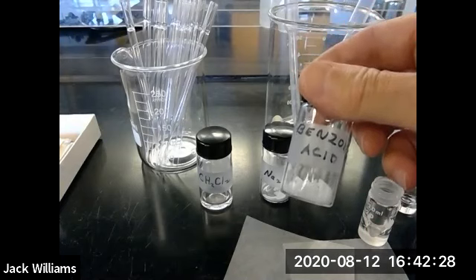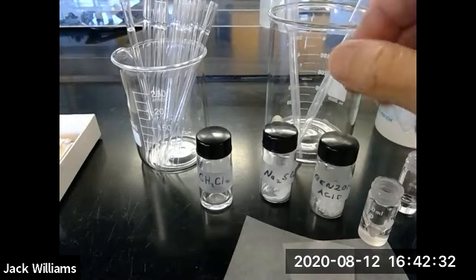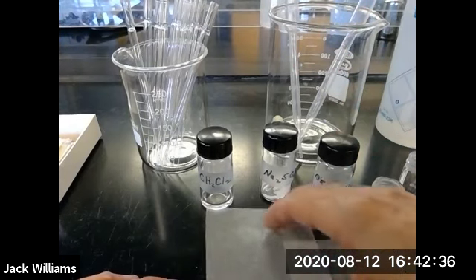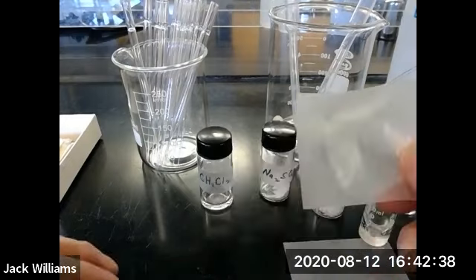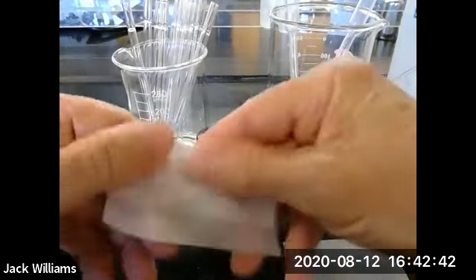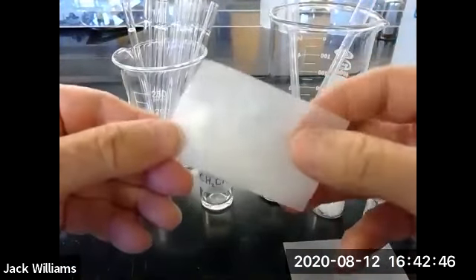All right, so there's your benzoic acid. You're going to weigh up a certain amount of this, and you're going to do this using a piece of weighing paper. Looks like this. And when you use this, you just don't fold it up and say, I'm just going to fold it up, throw it on the analytical balance, and weigh something. No, there's a way that you fold this.